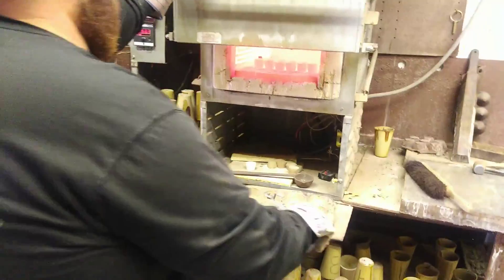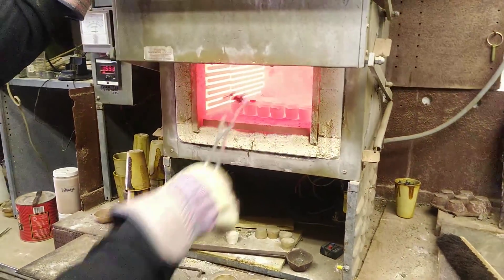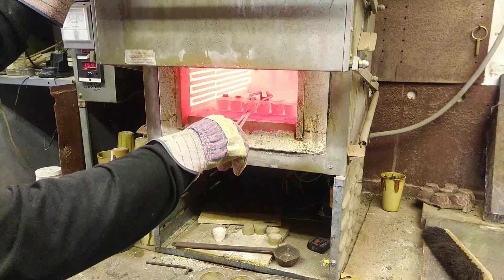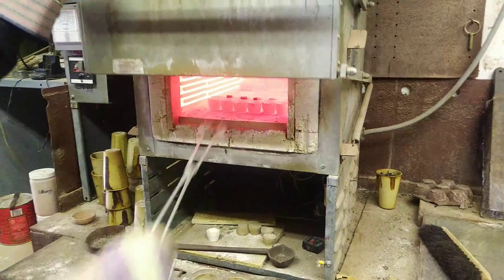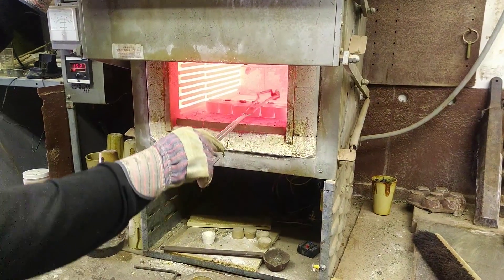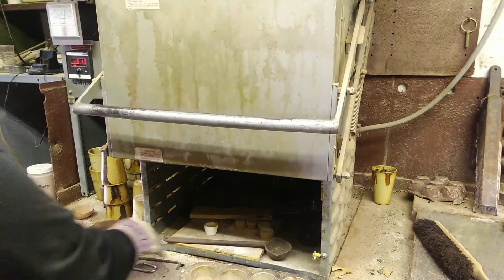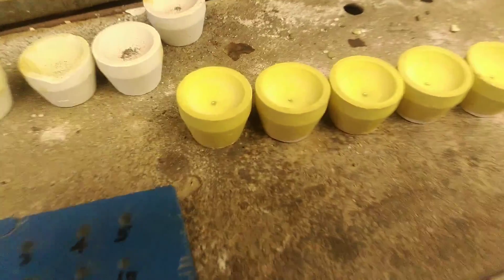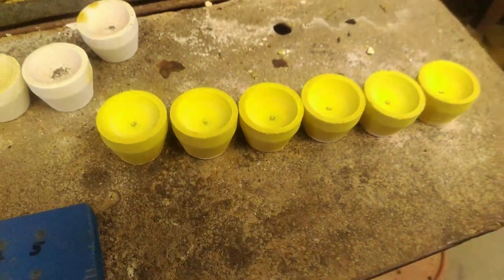Now we're getting the buttons in the cupels in the furnace, set to about 1,585 degrees — just losing some heat with the door open, which is why he's closing it a little bit between each. Energy efficiency as much as possible. I should have used the insulated gloves, that's getting a little bit toasty. This is post-cupellation — these are the doré beads left over. The whole lead button has evaporated and been absorbed into the cupel.